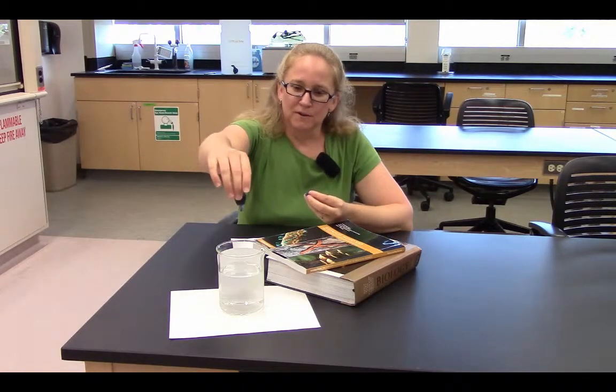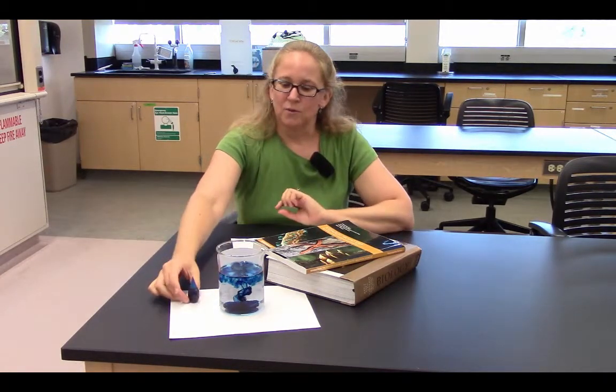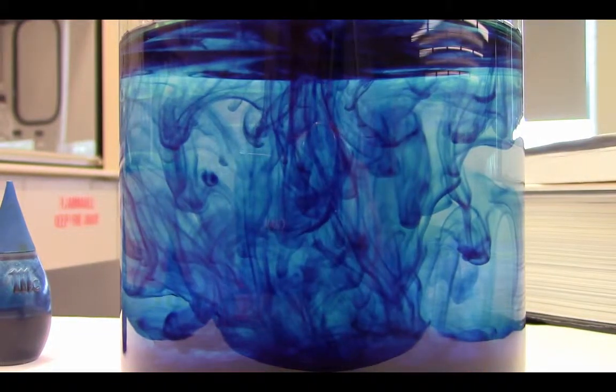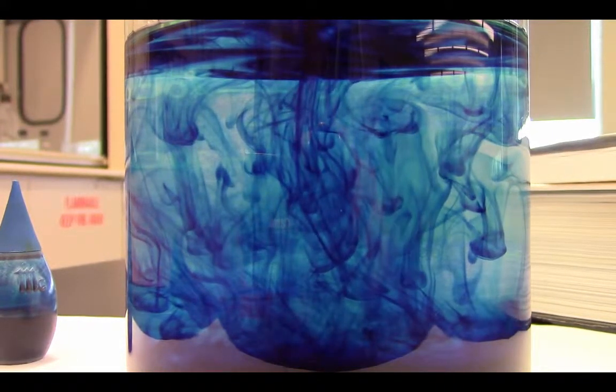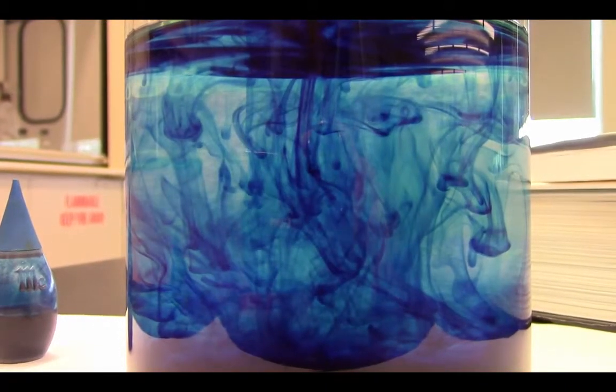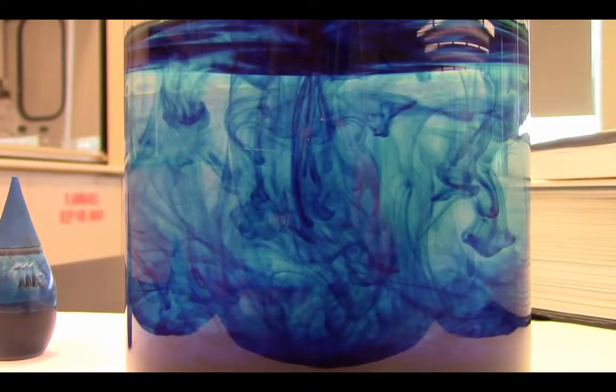Let's set up a demonstration to check at the end of this video. Here I have a beaker of water and some regular food coloring. I'm going to drop in five drops of dye. You can see swirls of dye spreading down into the water from those original point sources. The dye will move in all directions until uniformly distributed, while water — more concentrated in the beaker — spreads into the dye. We'll check the beaker again at the end of the video.